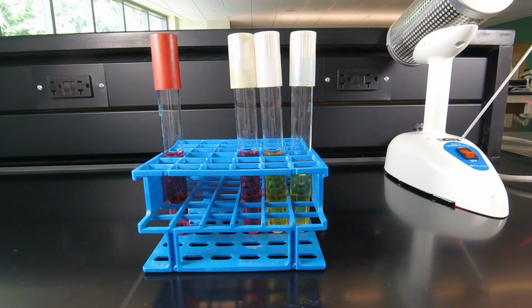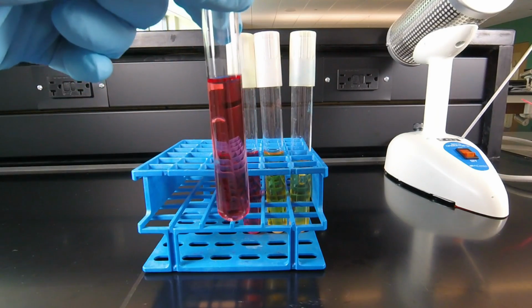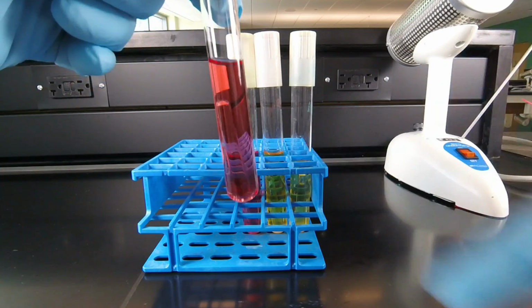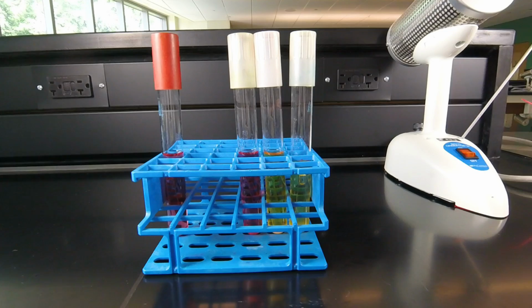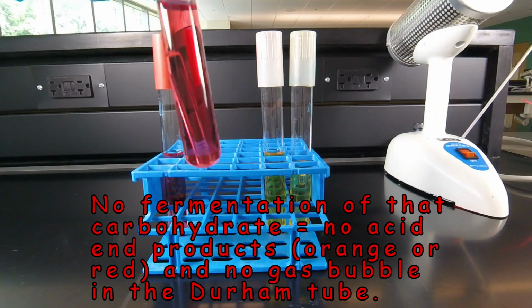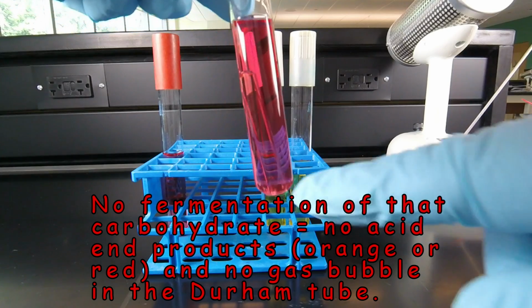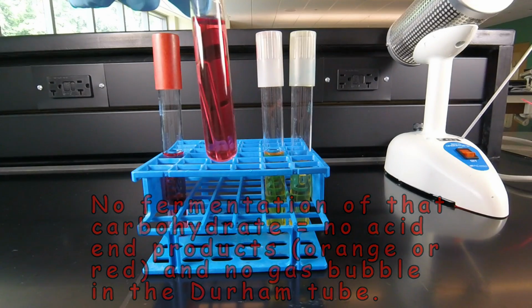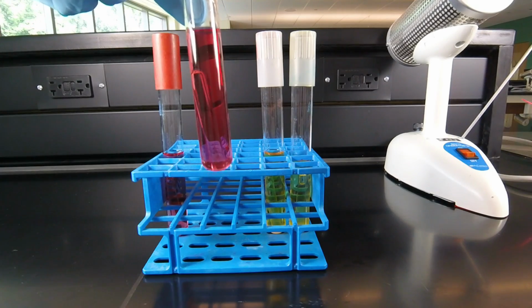So here we see the three possible end results of fermentation. Now this is an uninoculated tube again that you started with. Notice it's red, indicating a neutral pH, and the inverted test tube has no gas bubble in it. Now one possibility is that the bacterium won't ferment the carbohydrate. And as we see in this case, the Phenol Red has remained red, indicating no acid production, and there's no bubble in the gas tube. So that will be no fermentation of the carbohydrate. In this case, the carbohydrate is lactose, so that will be no fermentation of lactose.